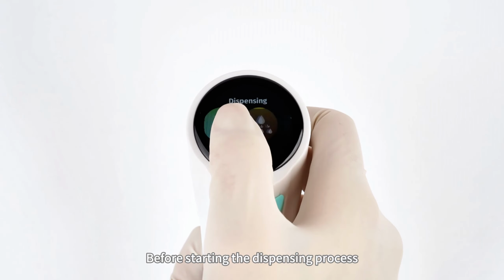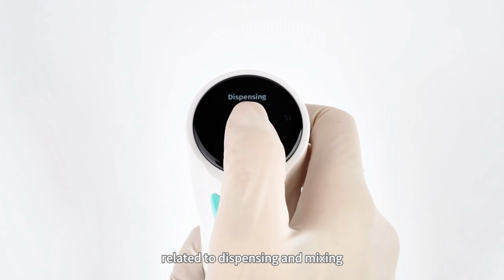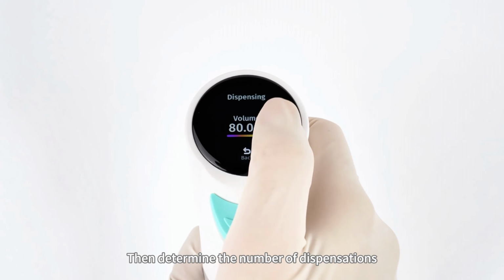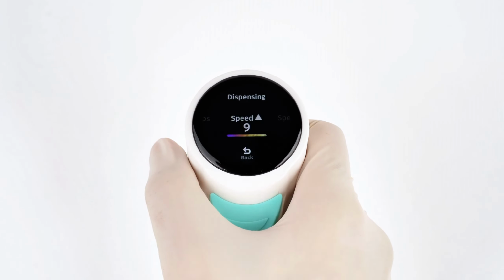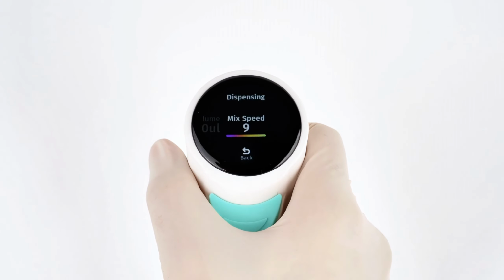Before starting the dispensing process, we also need to adjust the parameters related to dispensing and mixing. First, set the total volume to be dispensed. Then determine the number of dispensations. Setting is complete. Enter the dispensing operation.